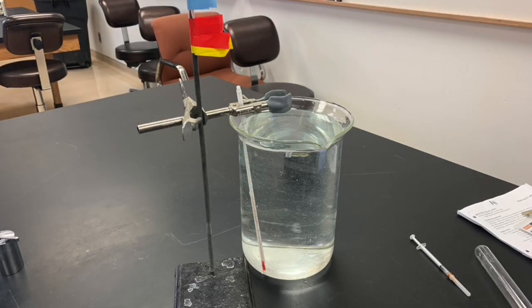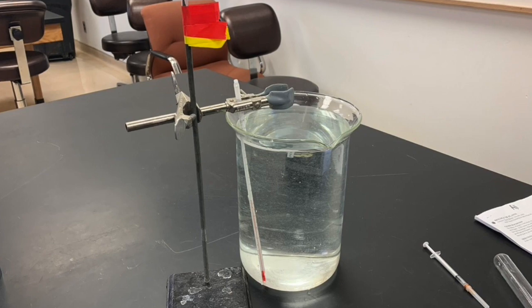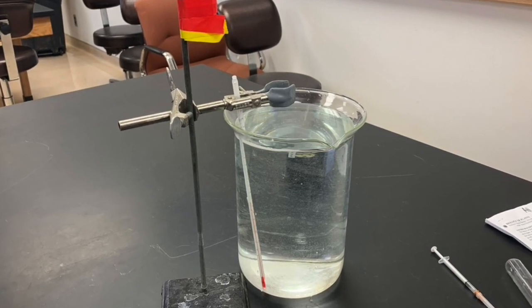Now the last variable we can manipulate in this experiment is temperature. And to go about manipulating temperature, we can use our beakers filled with warmer or cooler water. So hopefully you all understand the setup of this experiment, and now you have the opportunity to learn how these 3 treatments affect the rates of photosynthesis in plants.